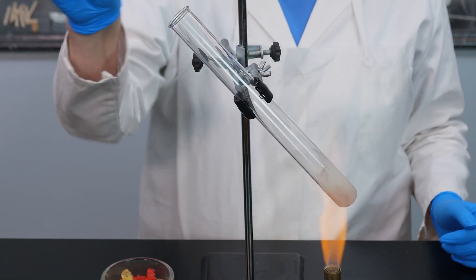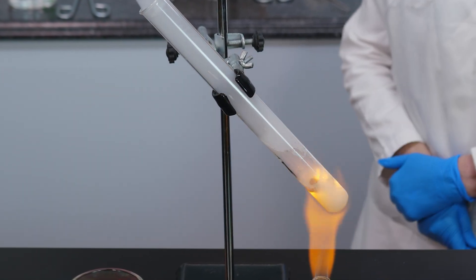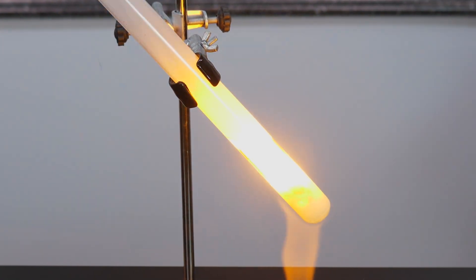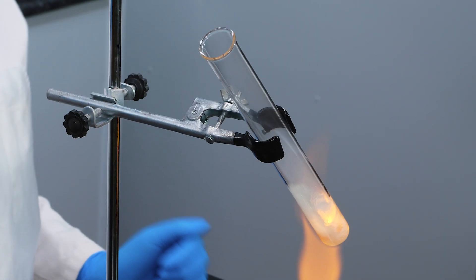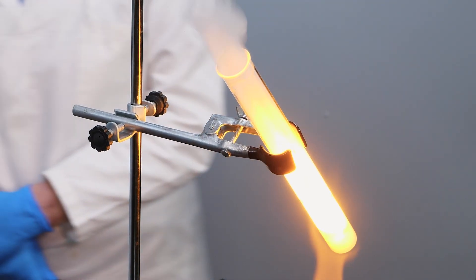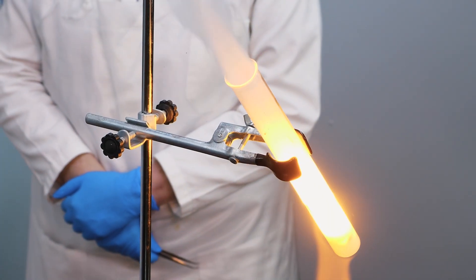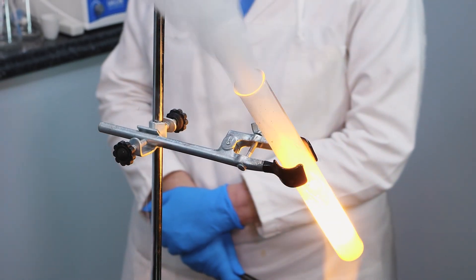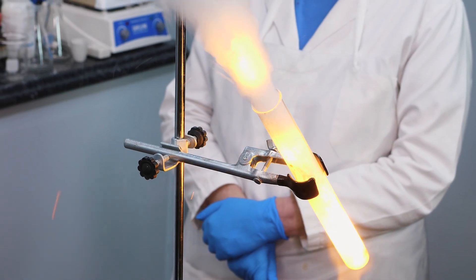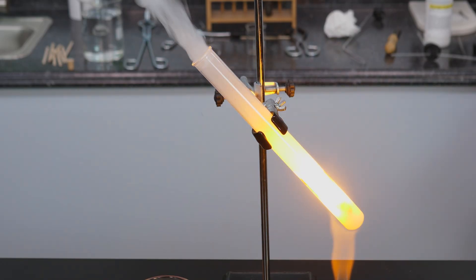Let's watch that again in slow motion. As you can see, oxygen is an excellent oxidizer. The same amount of energy is released inside your body when you digest a gummy snack. But the reaction inside your body is much slower than the one we see here. However, gummy snacks do release energy quicker than other foods. They provide a quick burst of energy, but they have no lasting nutritional value.